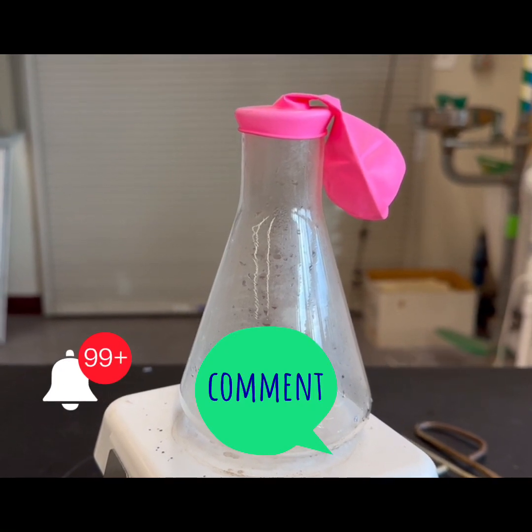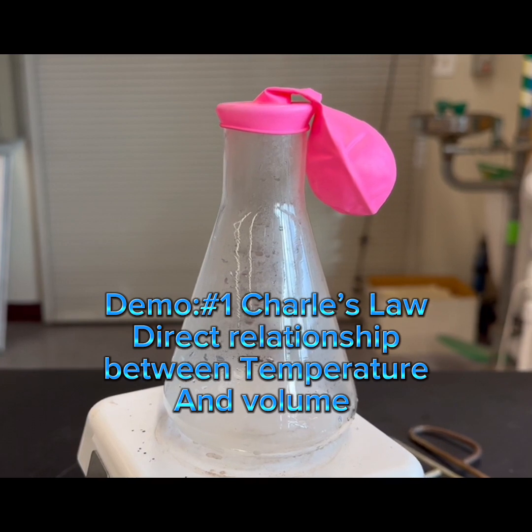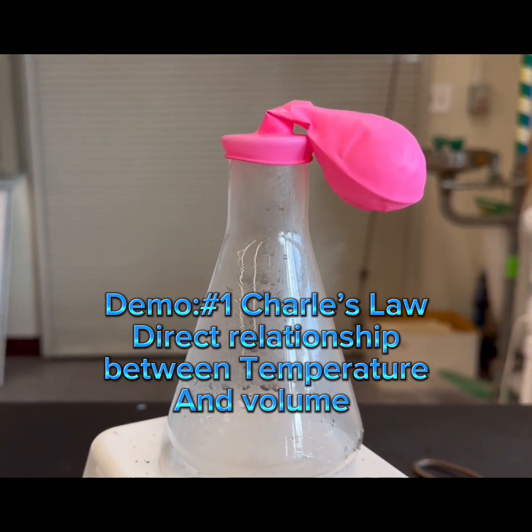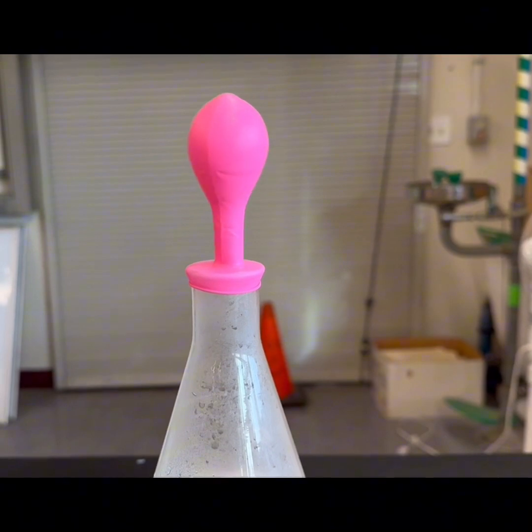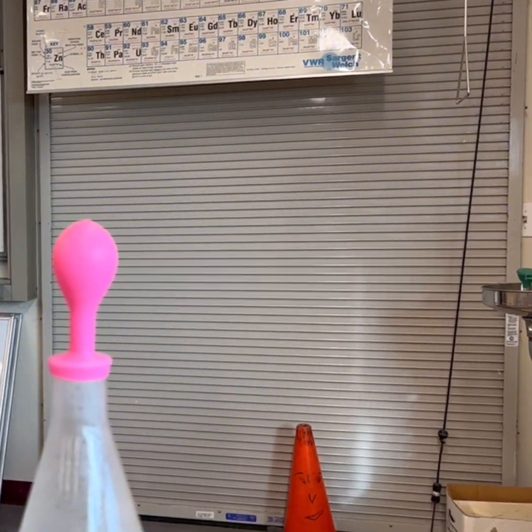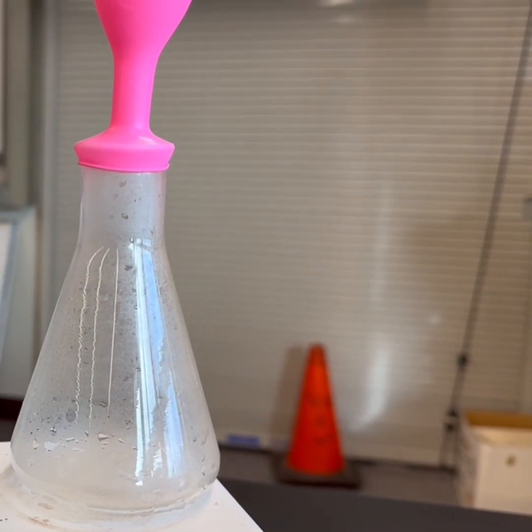As you can see right now, the balloon is down, and you can see it start filling up. We heated the flask, and now it's going up. There you go. Notice that when temperature inside increases, the volume of the balloon also increases.